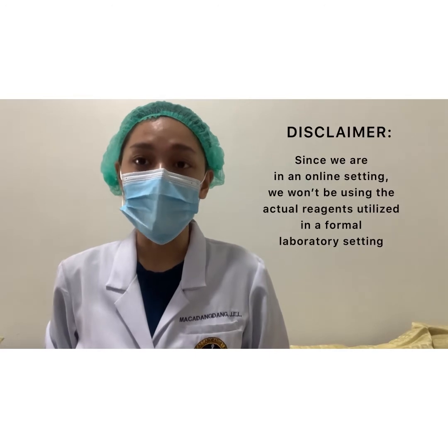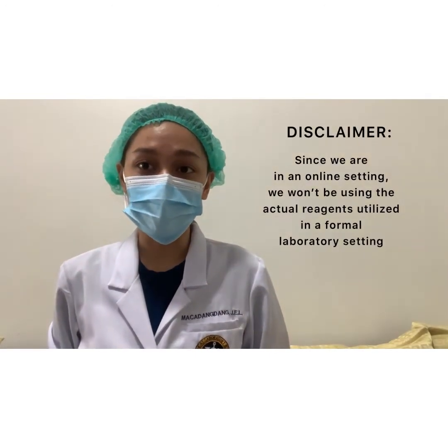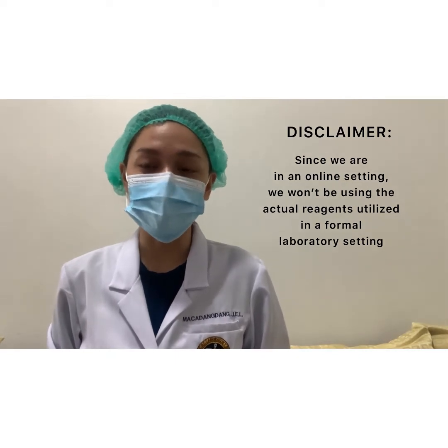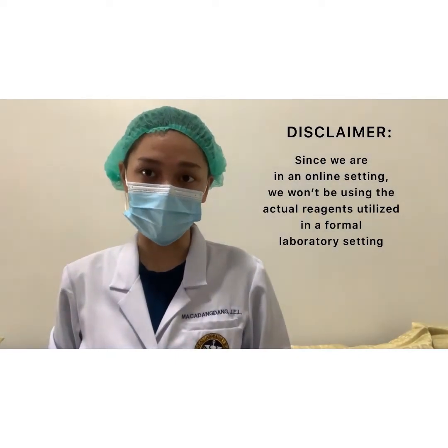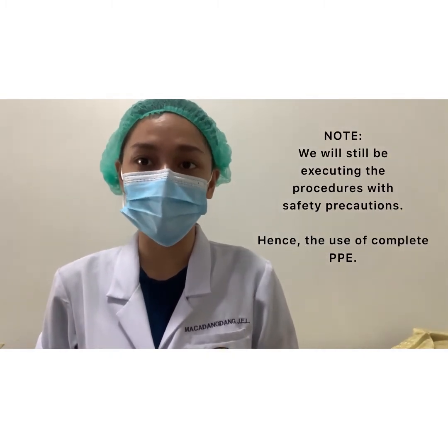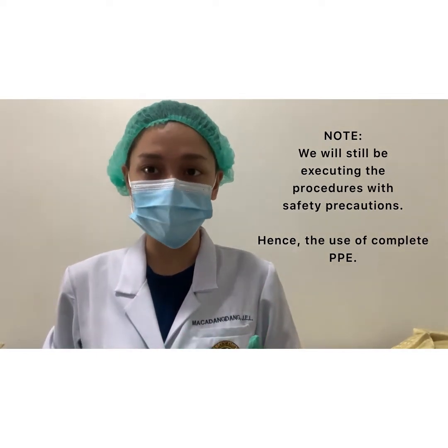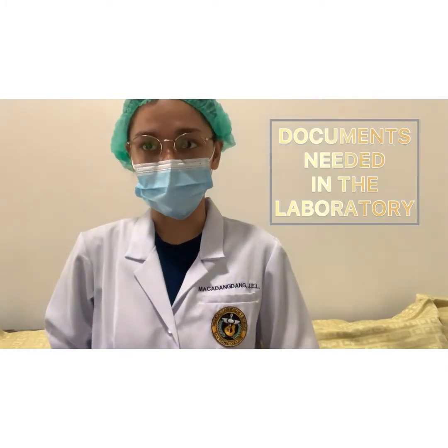Good morning. Before we begin, I would like to put on a disclaimer that since we are in an online setting, we won't be using the actual reagents utilized in a formal laboratory setting. However, even though this is the case, we will still be executing the procedures with safety precautions, hence the usage of complete PPE. To begin, I would like to formally start with the documents needed in the laboratory.